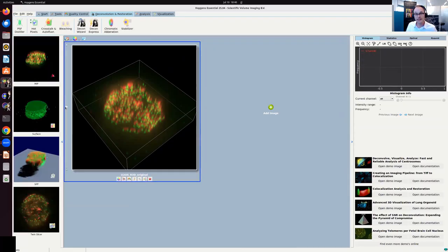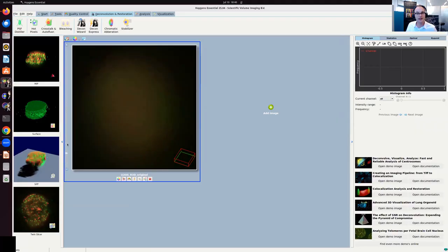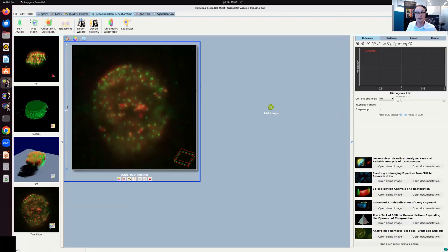So this is a wide field data set. It has been recorded according to Nyquist. Now I'm going through the Z slices. What I can see is that there is a lot of blurring, what I expect from wide field, but the SNR is rather high.